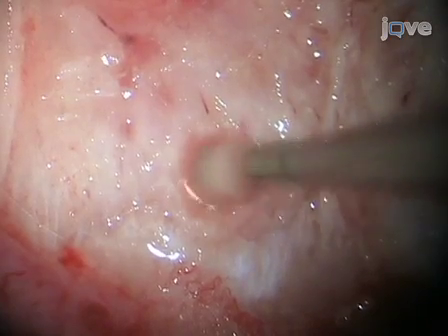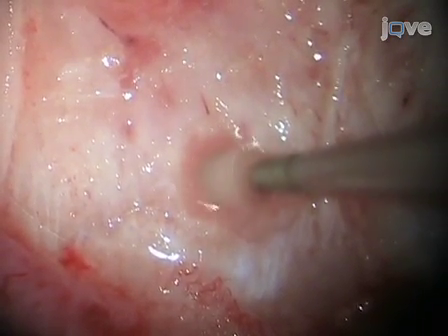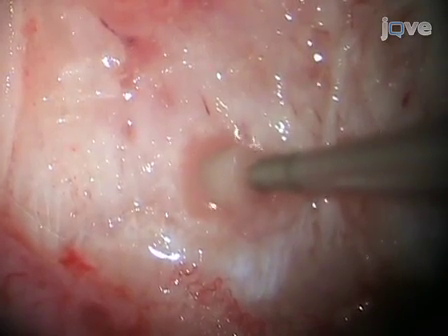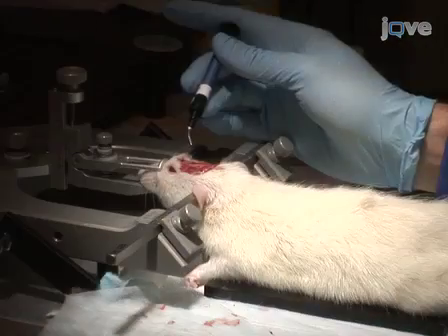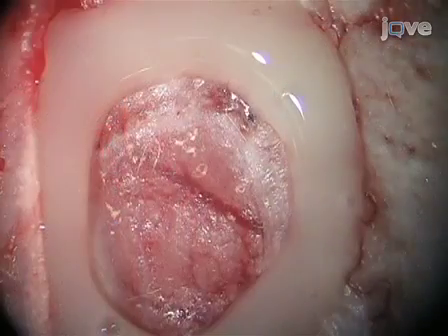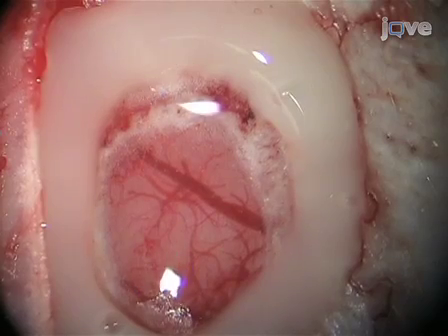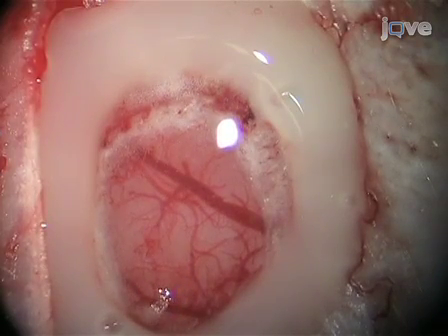Next, drill a small hole about 2 mm away from the window. This is done because the experiment later involves using a needle to prick the surface of the brain. Finally, use dental cement to create a well around the desired region and place a drop of oil or silicone gel into the well to improve visibility. With the animal prepared, let's see how to collect data.